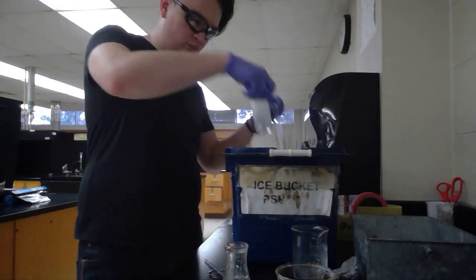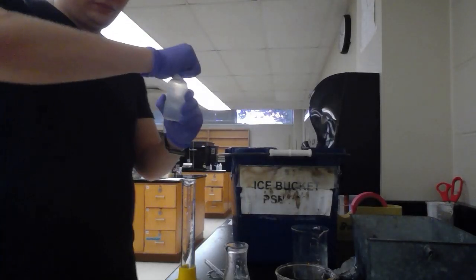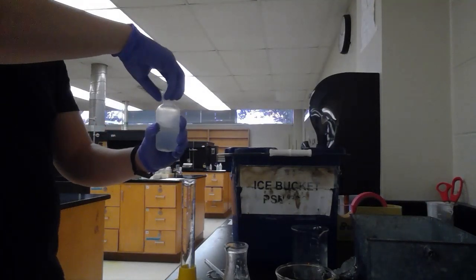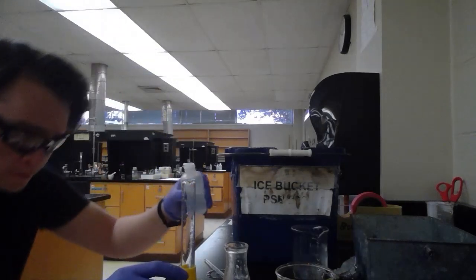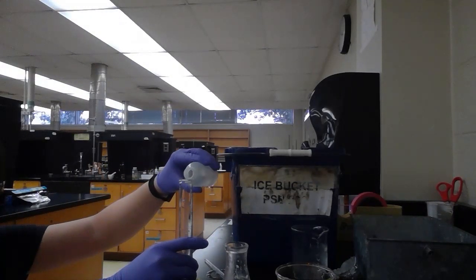Now we're going to take some more of the saturated sodium chloride solution that's been sitting in the ice bath, and do the same process again, to make sure we try to get off all of the glycerol through the salting out process.